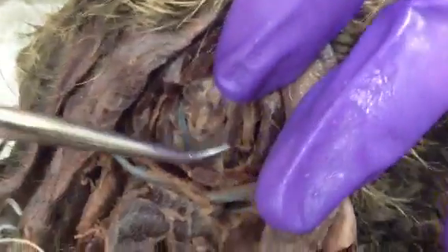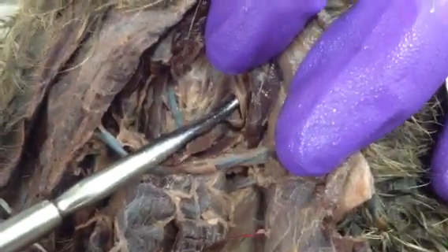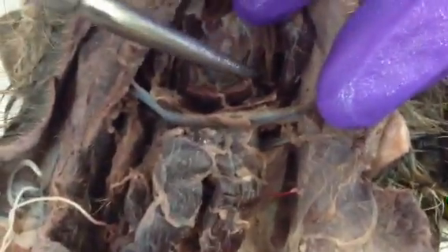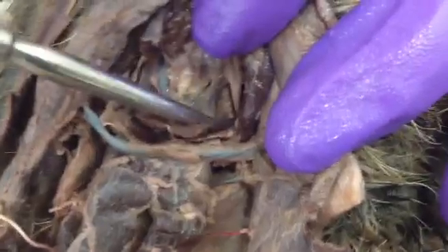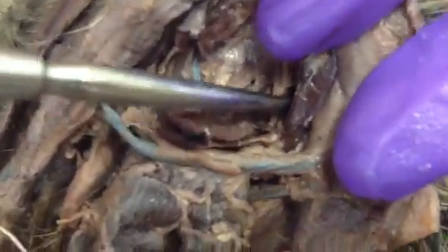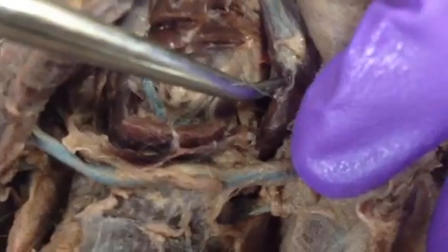And from the geniohyoid, a little bit more lateral to it, you have the nerve that runs right here, and that's the hypoglossal nerve, and it innervates the tongue. And then also lateral, kind of underneath this nerve, you have the hyoglossus. And then mine, you can't see it very clearly, but deeper in there is the styloglossus, and it originates from the back of the skull, and then it inserts on the tongue.